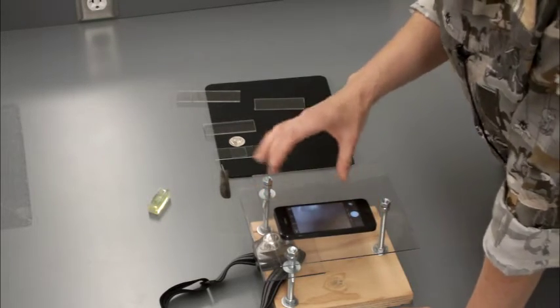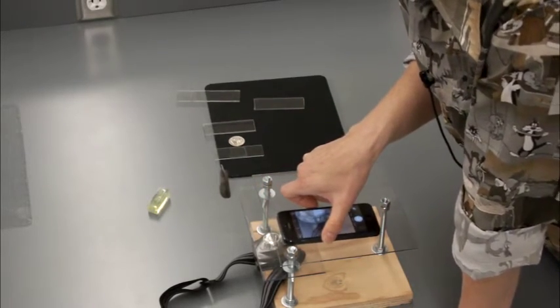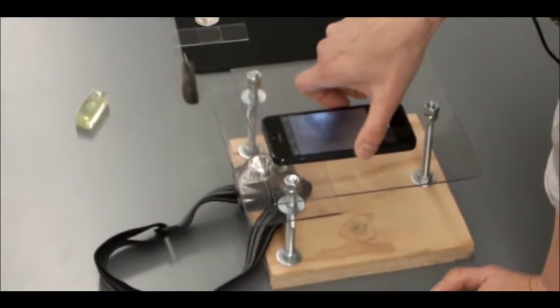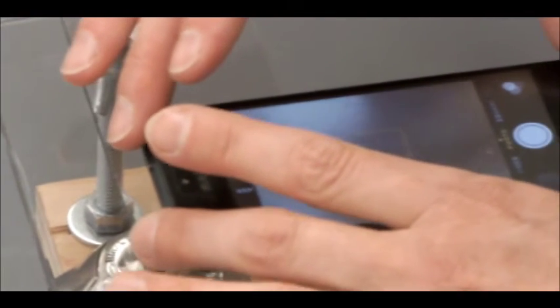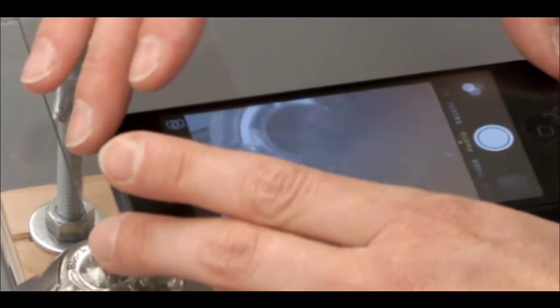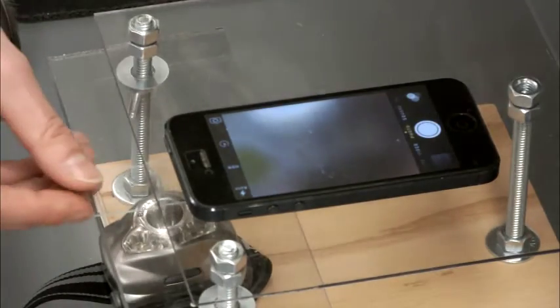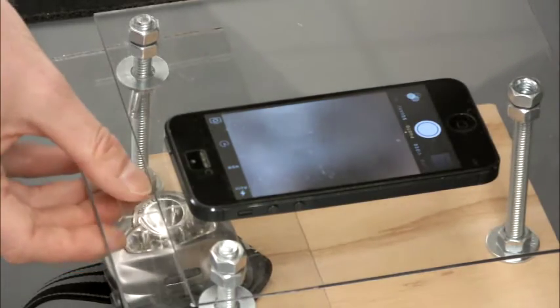So once you get the camera stage level, you're going to just line up your camera so that it's over that. You turn on the camera, you're going to line it up so that it's over top of the lens, and you'll kind of be able to tell because it gets a little blurry as we go over top of that. And then you can put whatever specimen you want underneath.